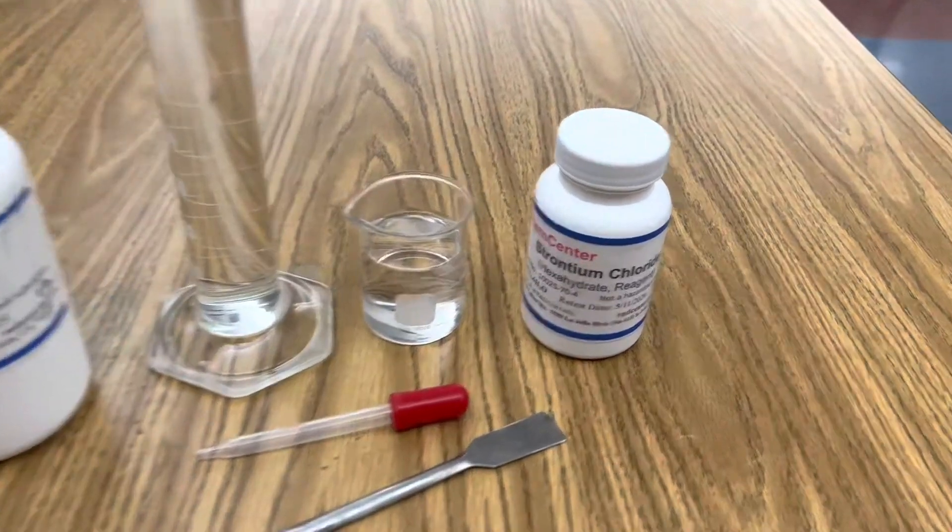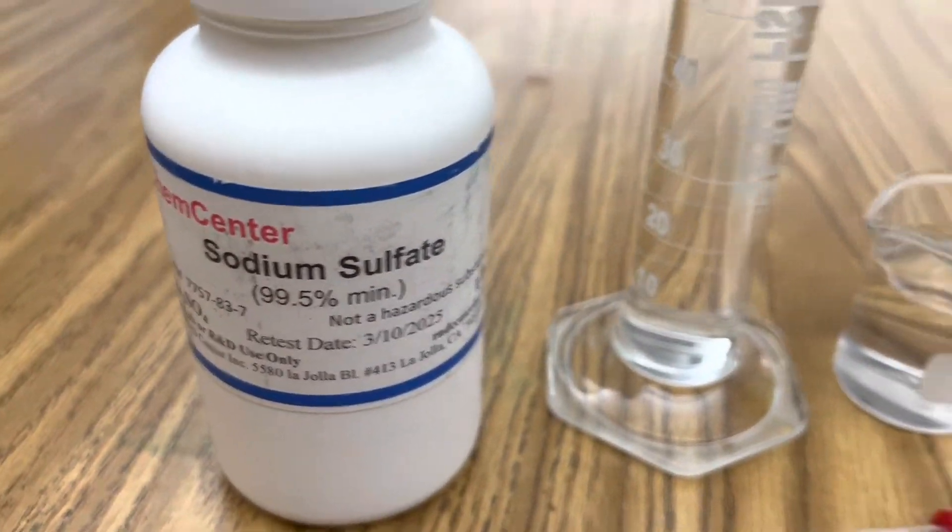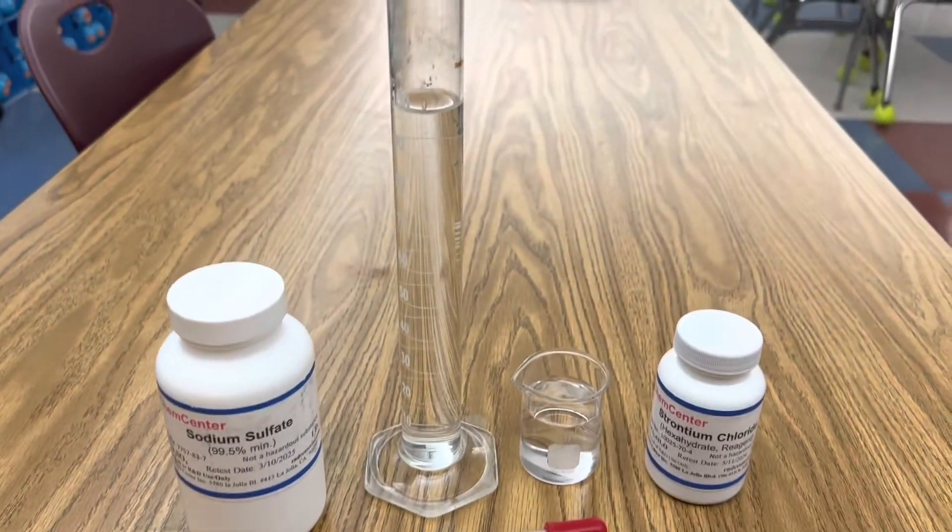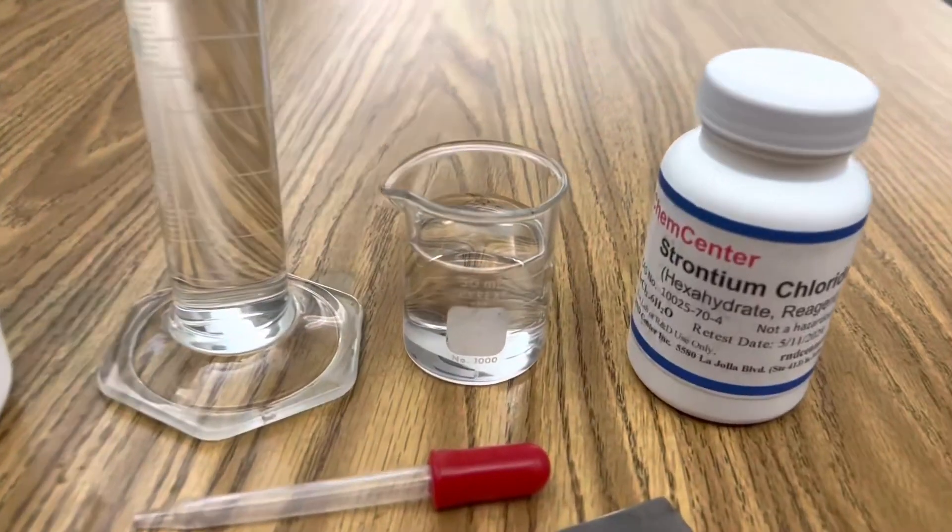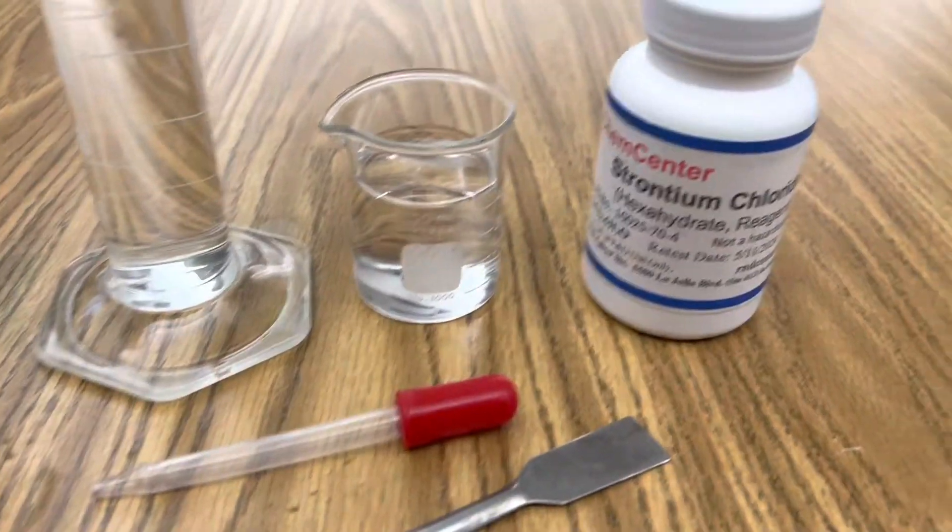All I'm using in this investigation is strontium chloride, sodium sulfate, a graduated cylinder with 100 milliliters of distilled water, a beaker with 40 milliliters of distilled water, a stir spoon, and a dropper.